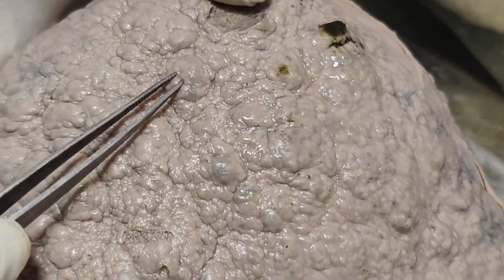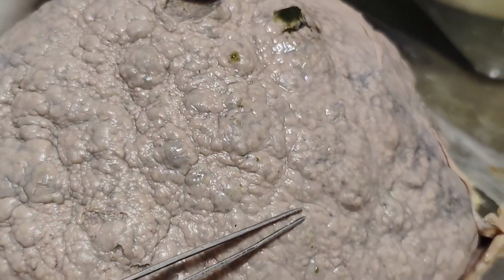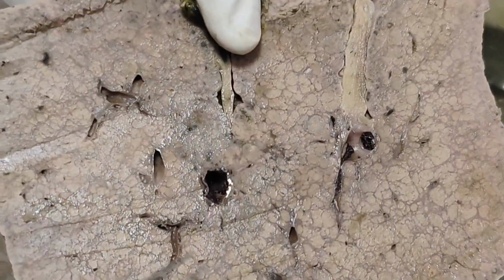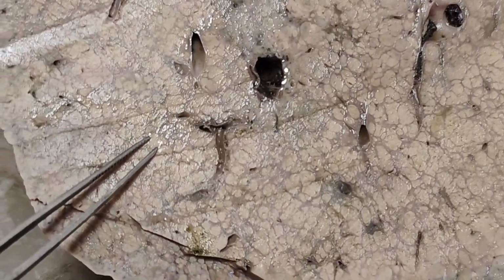There are so many nodules over the surface of the liver, and this is the cut section, you can see multiple nodules. All these are variable sized grey brown nodules, and in between you can see these nodule formations are there because of the fibrous septa. So this is the cut surface, and this is the classical presentation of the cirrhosis of the liver.